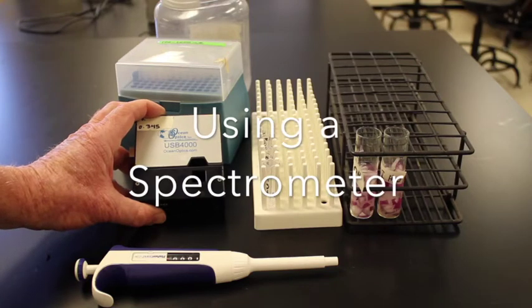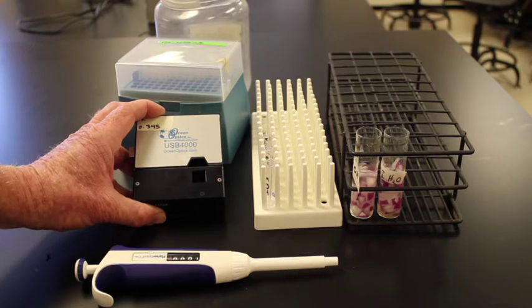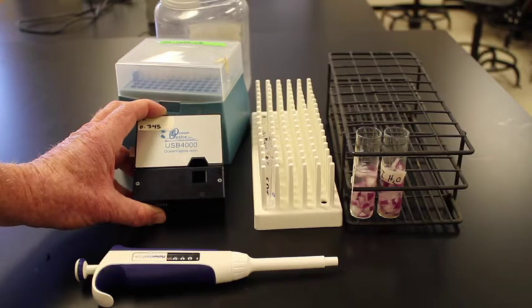The spectrometer hooks up to the computer and runs on software, and basically is going to be used to measure the amount of light that gets absorbed by the pigment in the solution. So it's basically going to give us an estimate of the amount of pigmentation in the solution.